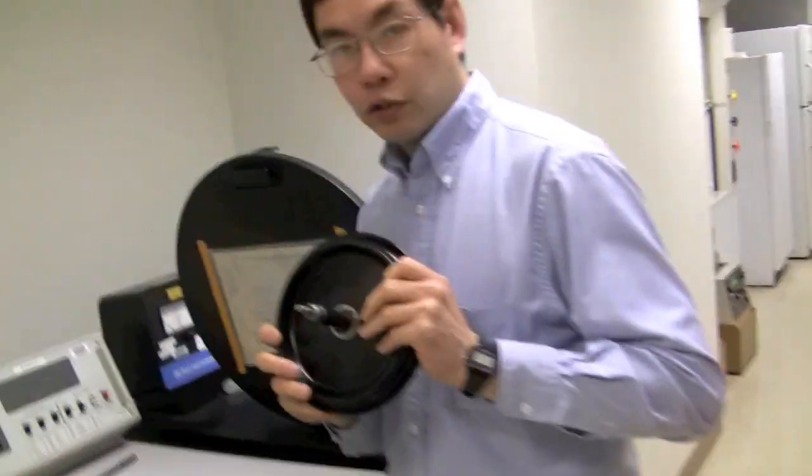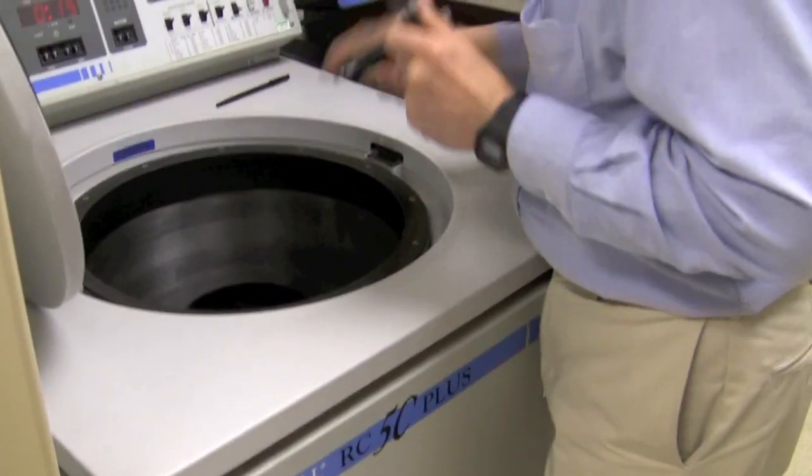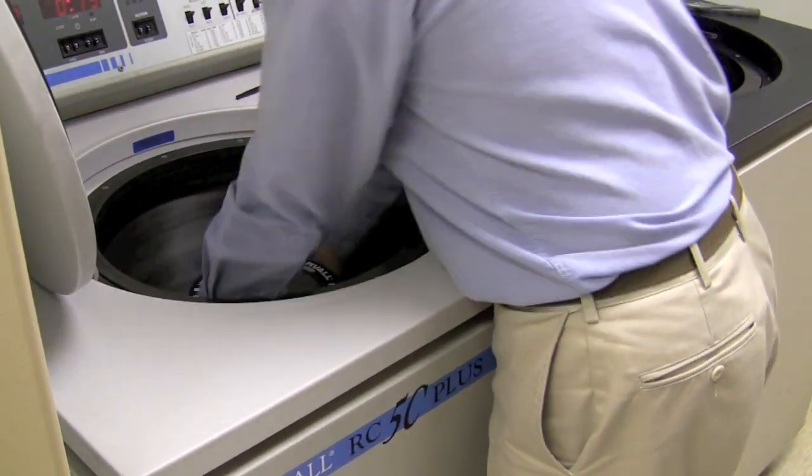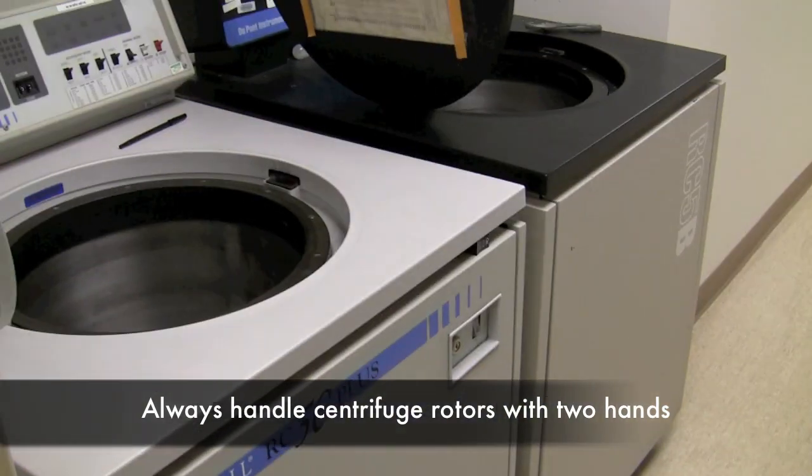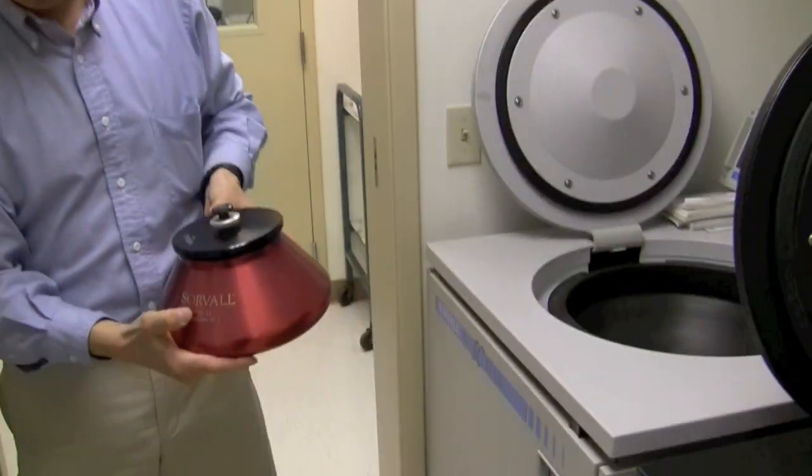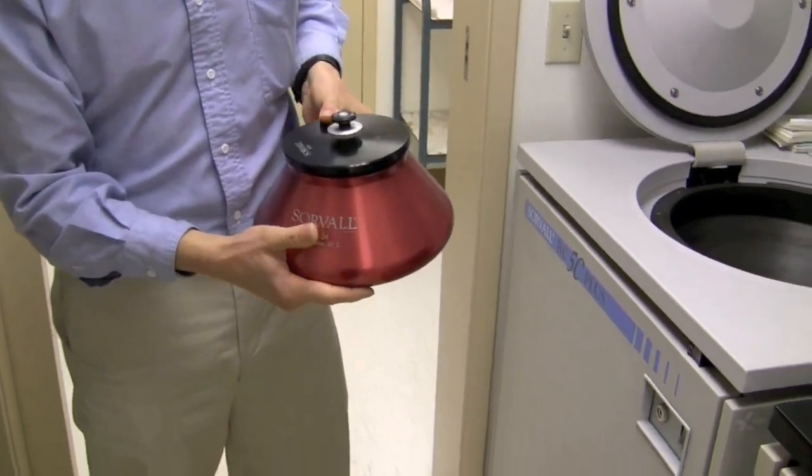Okay, first I have to change the rotor. This is a medium-sized rotor. Lift the rotor out, put it on the right. This is the rotor we want to use, it's the Sorvall SS-34 rotor.